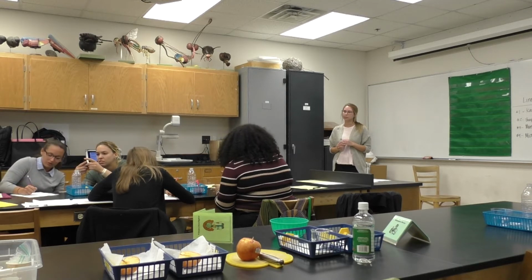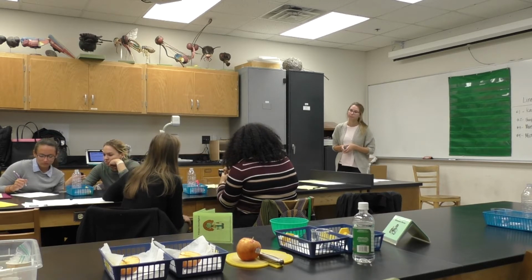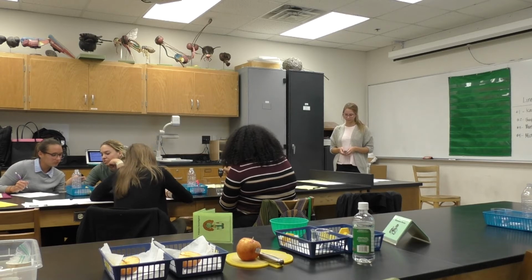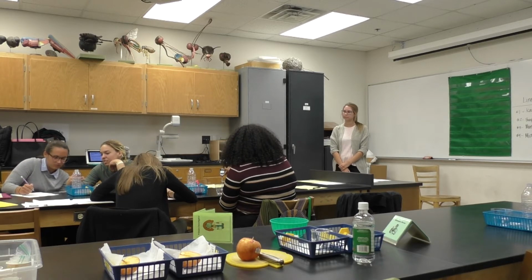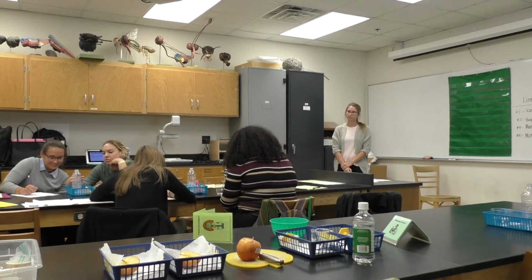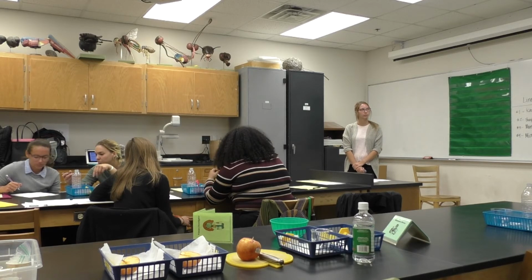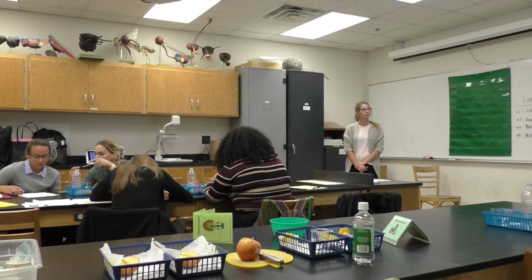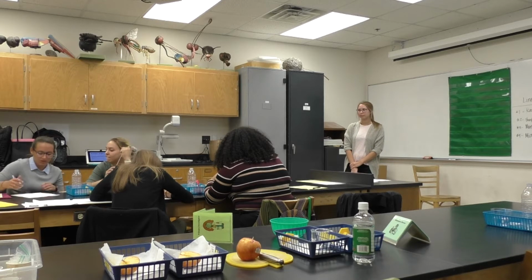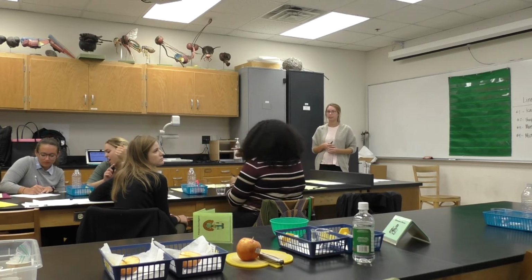You're also going to measure the temperature. So use a thermometer, just press the power button and place it in the water. Still good. 68.5 degrees Fahrenheit. Any other observations? Okay, once you're finished with that portion, the primary investigator can perform the procedure, which is listed on your exploration guide.